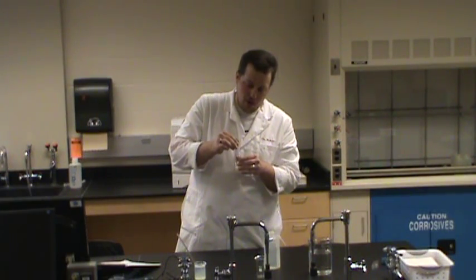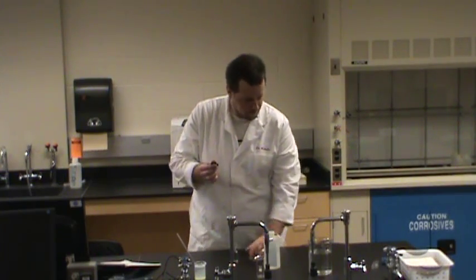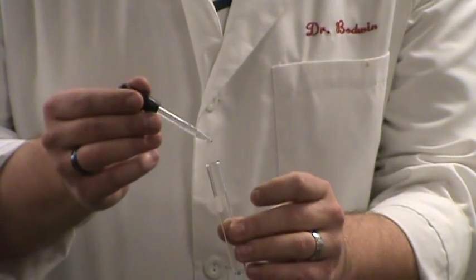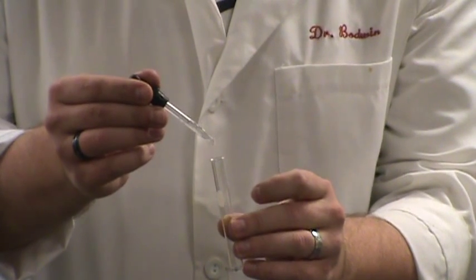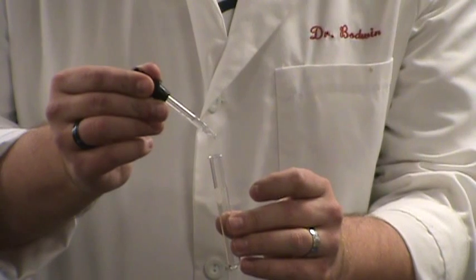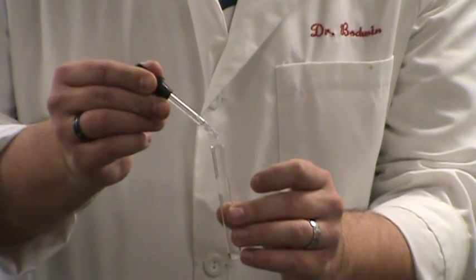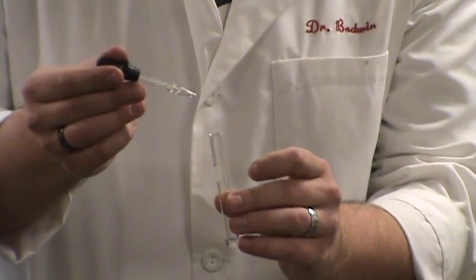You need to be using your droppers properly, and what does that mean? That means that if I want to add drops to something, I should hold the dropper above the mouth of whatever I'm adding to, like this test tube, and add my drops that way. By doing that, I won't get a bunch of whatever could be in the test tube on the dropper.